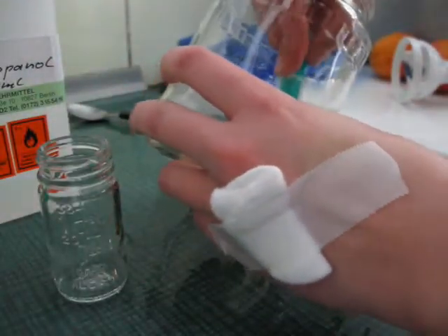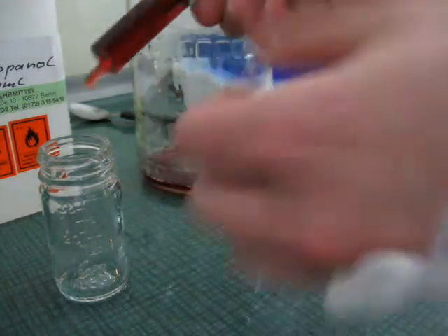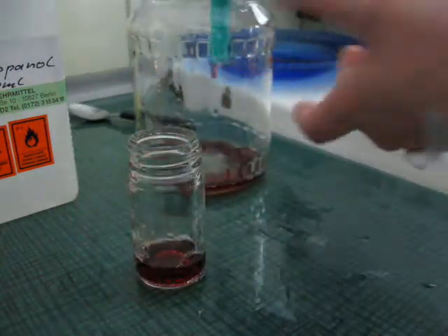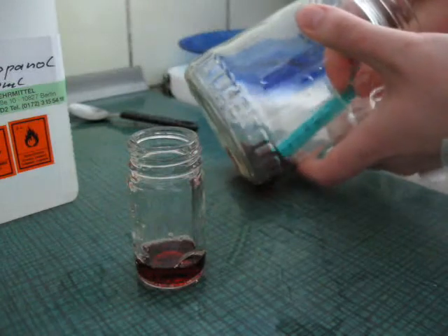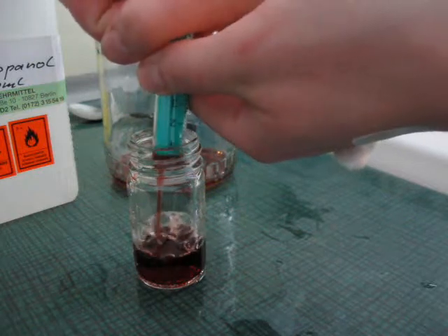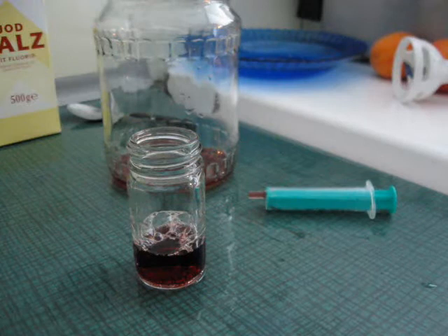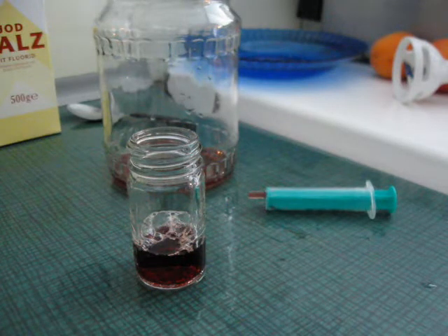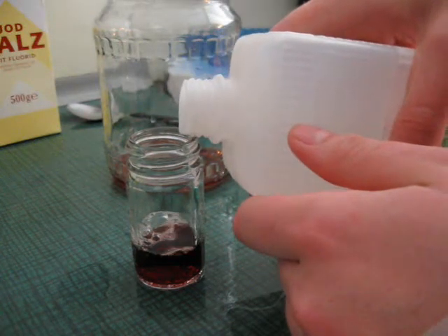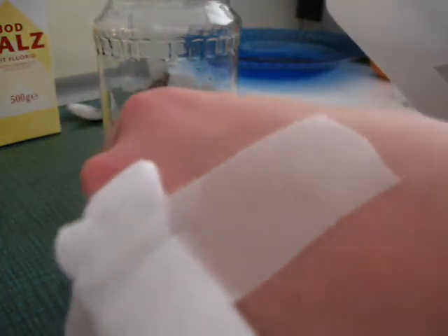I will then take a couple of milliliters from my blood solution and put it in a smaller vial — we'll use 10 milliliters. And then very carefully add the isopropanol, 10 milliliters as well.